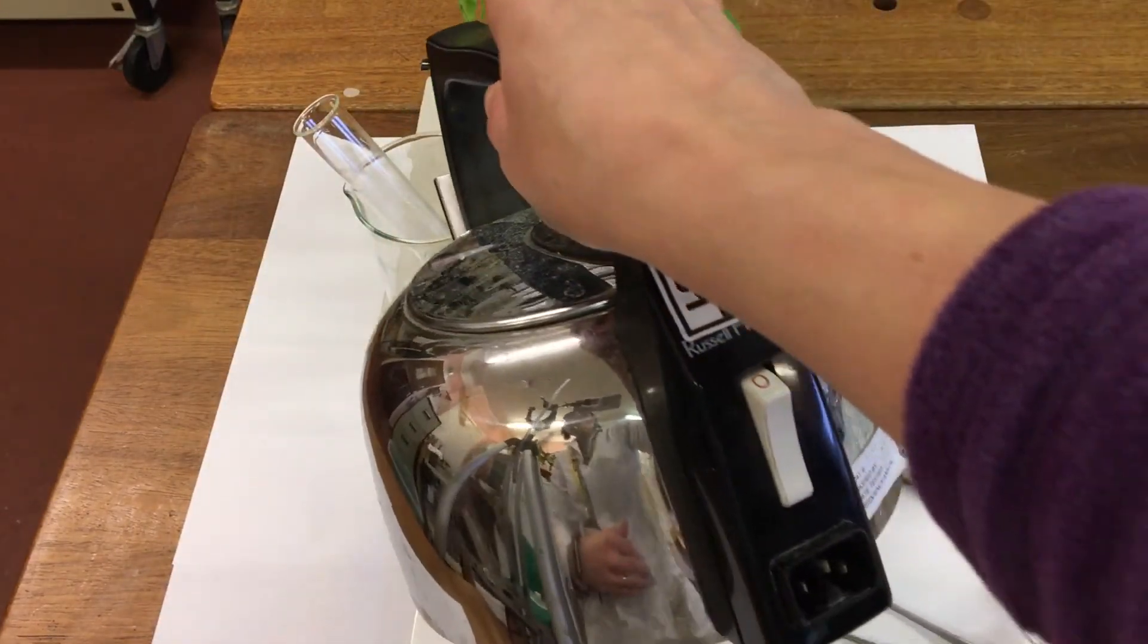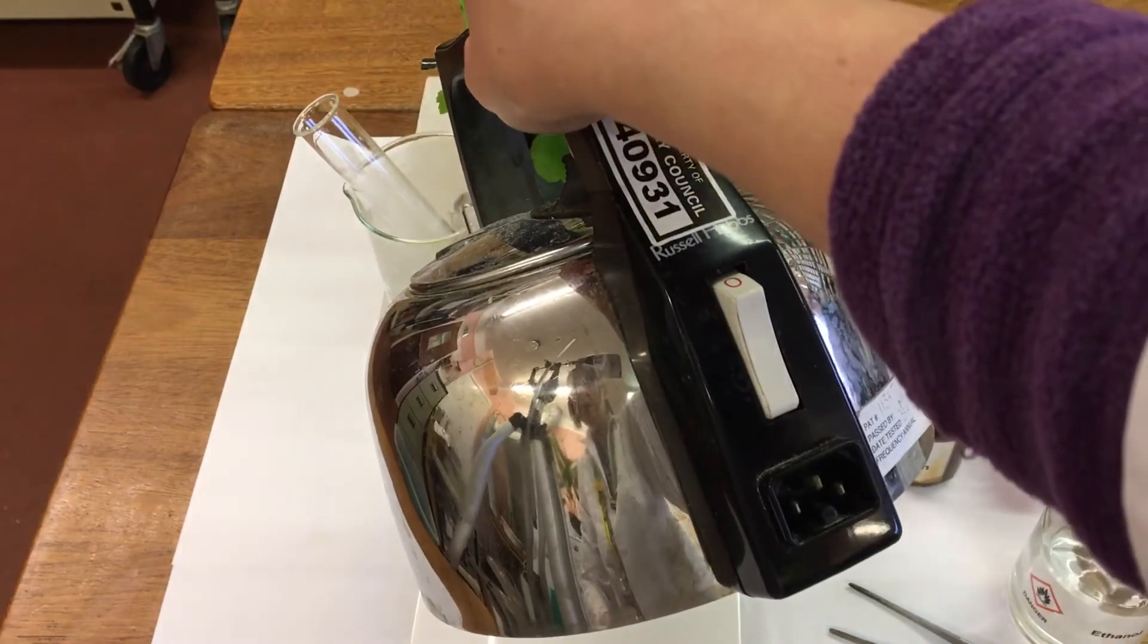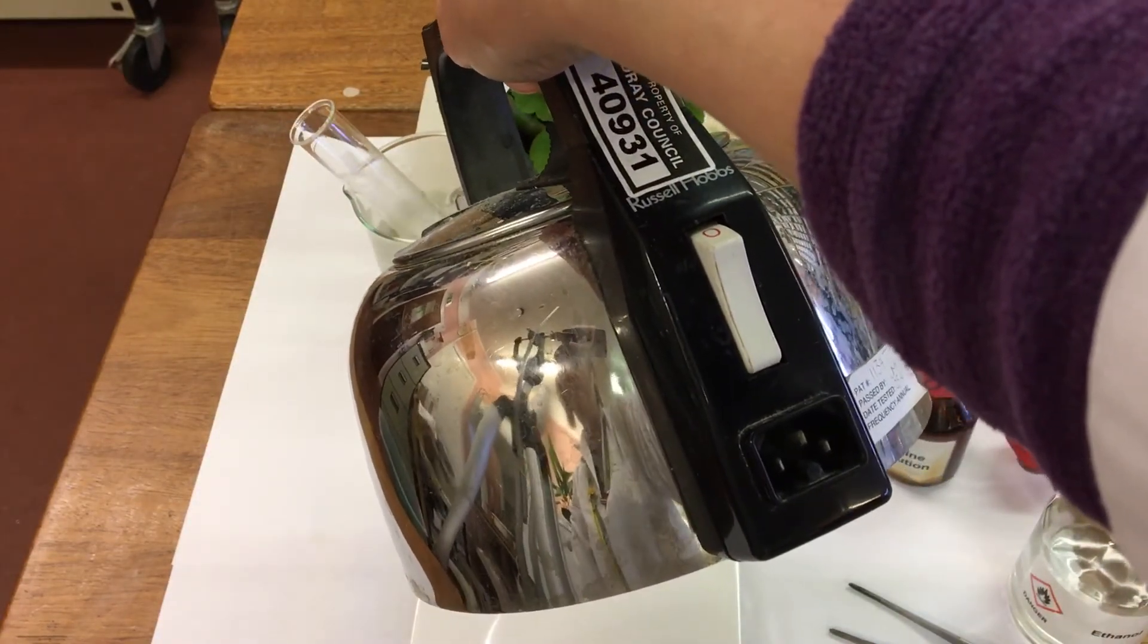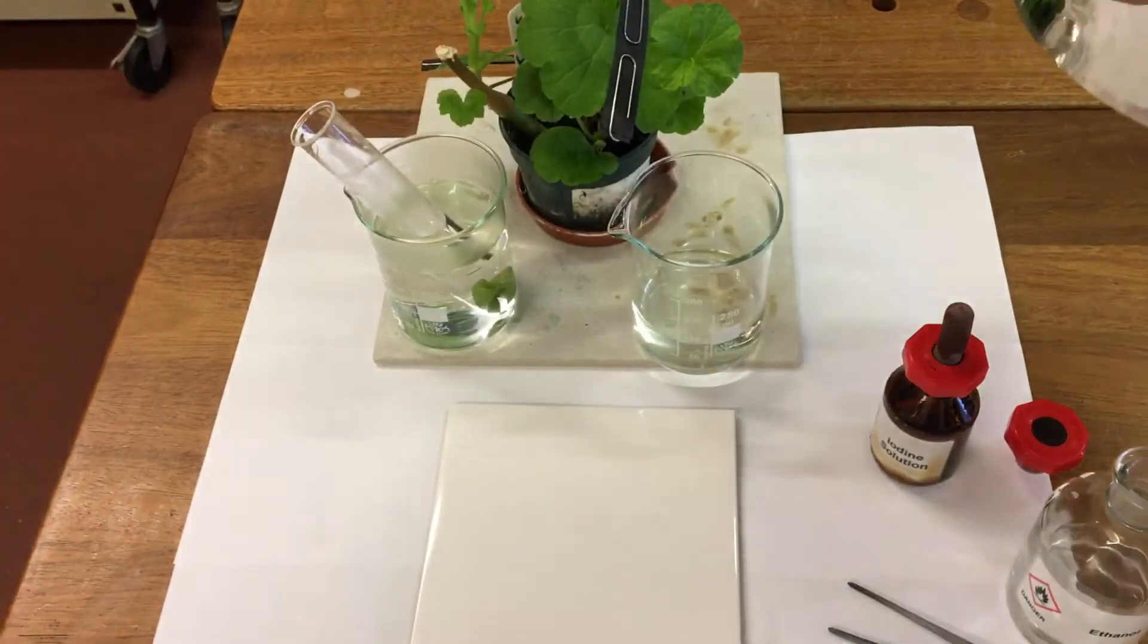Then we're going to add some freshly boiled water again. Then we're going to boil our ethanol.